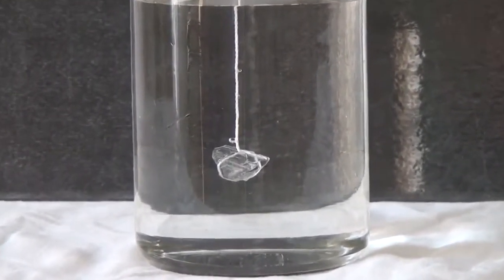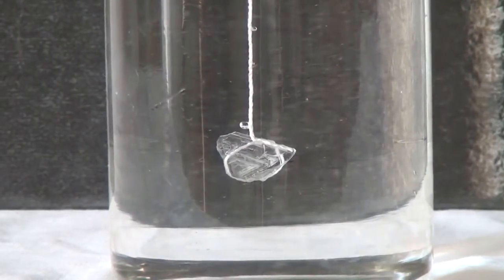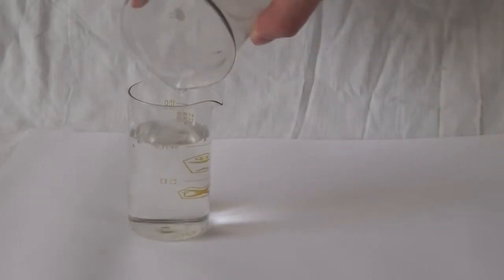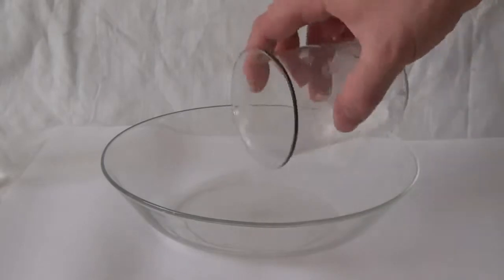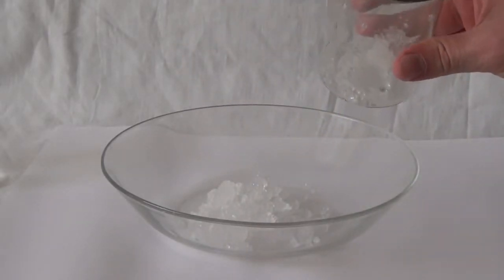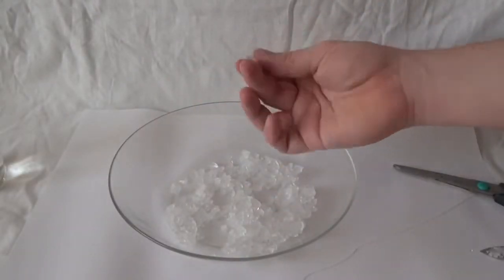A seed is a small crystal that is immersed into the solution, which will continue to grow new layers of crystal on top of it. Now, let's pour the solution into another beaker. Next, choose the most beautiful and large crystal from the mass of crystals that were formed at the bottom of the cup, or the one that is easy to tie on a thread.